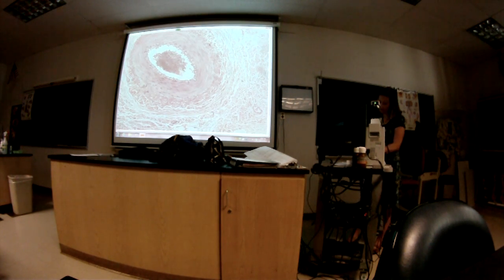Several names. Question 7 was, what kind of tissue? That's smooth muscle. Yeah, that's the one that does the vasodilation and vasoconstriction. That's the function of that smooth muscle. It changes the diameter of the blood vessel, allowing more or less blood to flow through. And then we move to the lung. Any questions on this one before we move it?